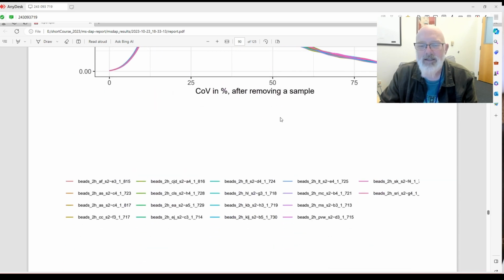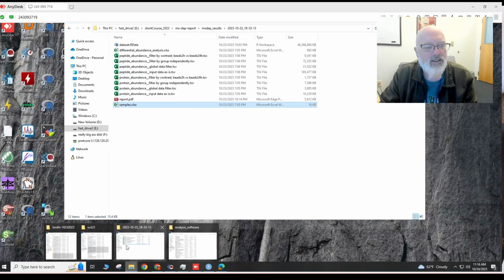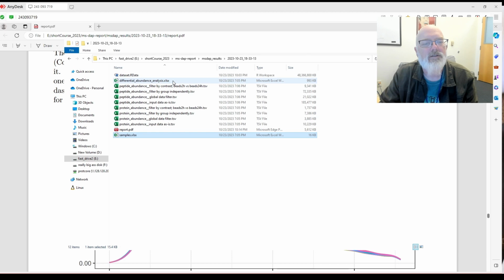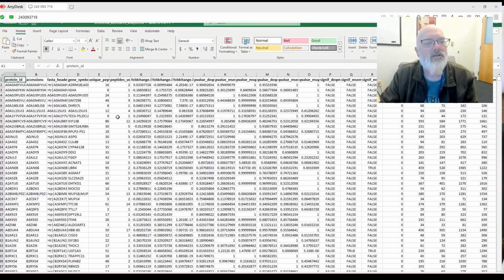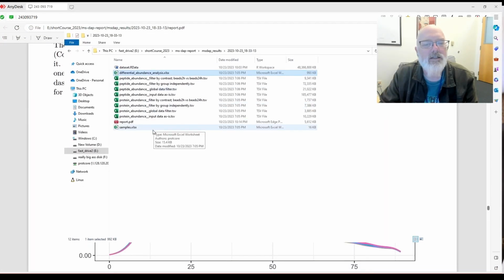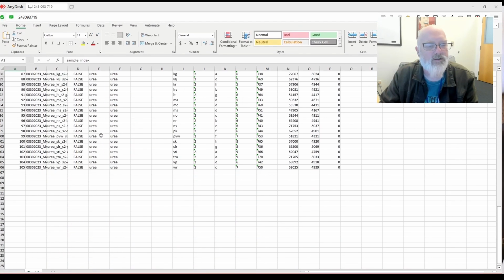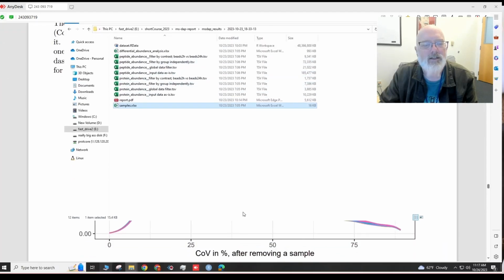Okay, so where is that metadata? That's a good question. I'll have to go and look at that. I don't exactly know. Is it here? Exclude. It's a good question. Maybe it was under samples. Exclude. Those are all false, so that's not it. Okay, I will have to look.